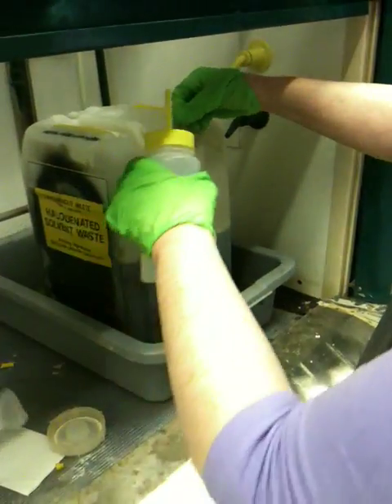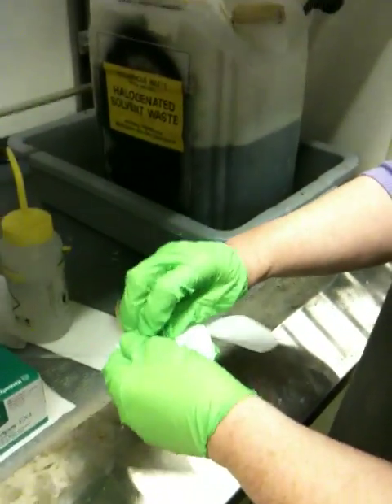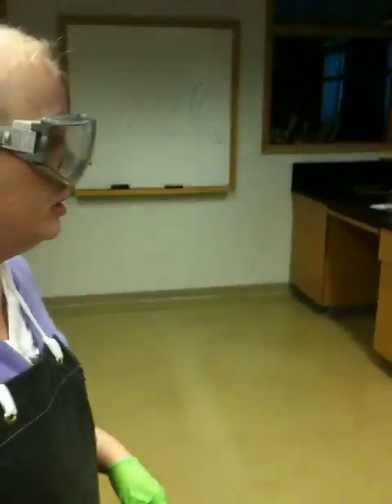I'm going to clean it a little more. I have kind of shaky hands, so I tend to drop things. Watch it with dichloromethane — sometimes it goes through the gloves, and if it does, your hands will burn. You should immediately take the gloves off and wash your hands.